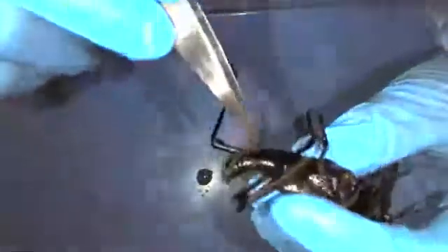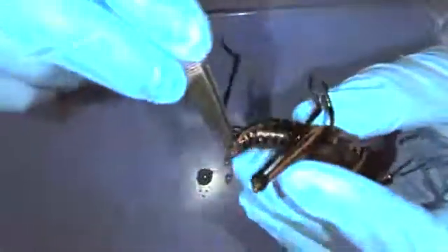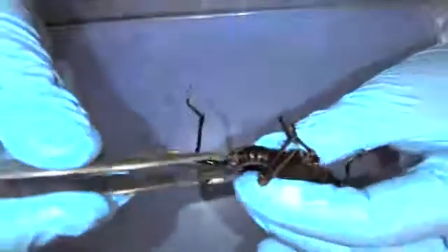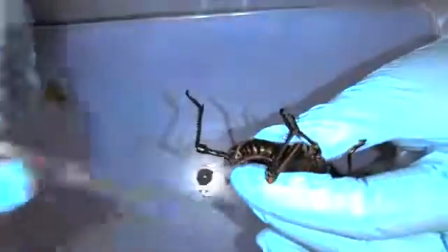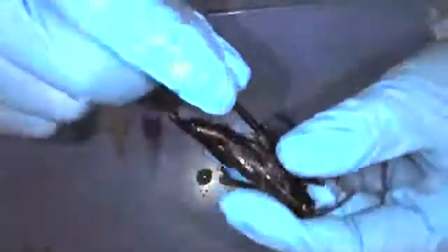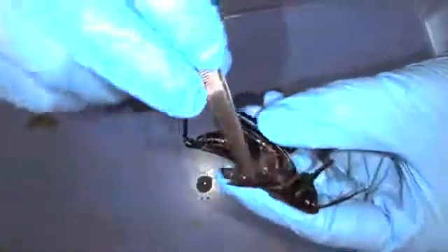Those spikes are for sensory function and a little bit for defense. At the very back of the body is the abdomen. In the abdomen, this is where they release feces, and this is also how they mate — they have something called an ovipositor at the very end that helps them reproduce.